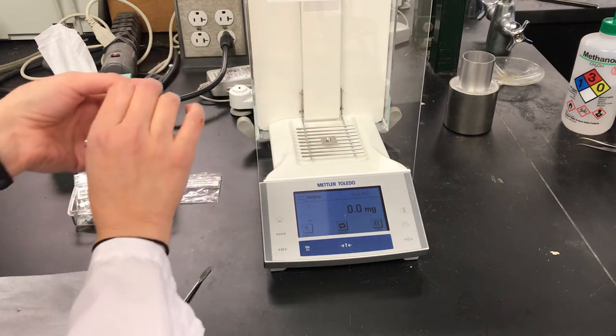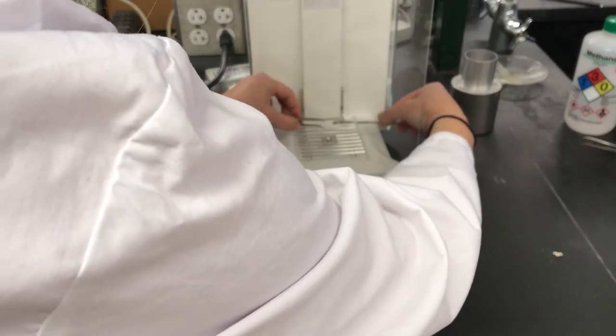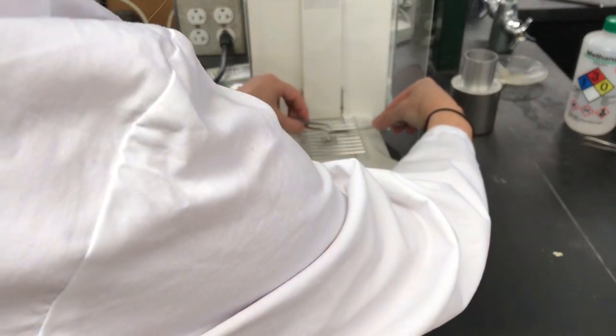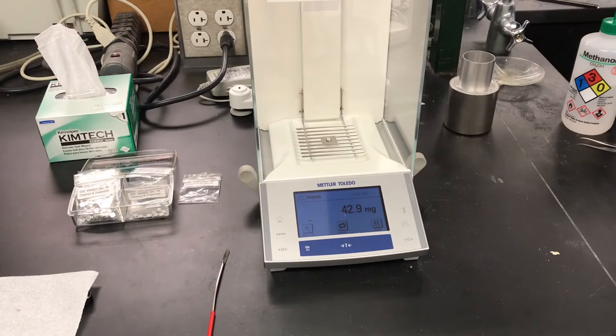I'll tell you what, this is incredibly challenging while making a video. There we go. And record our mass. 42.9 milligrams.